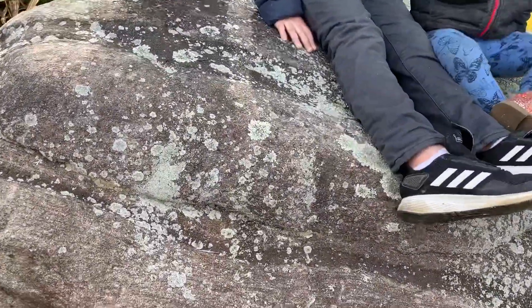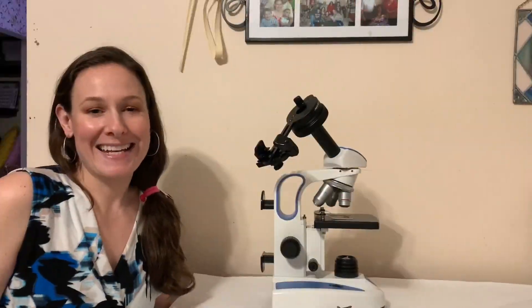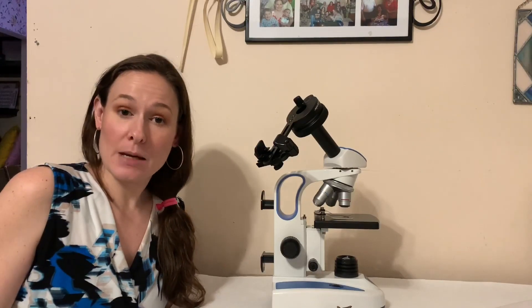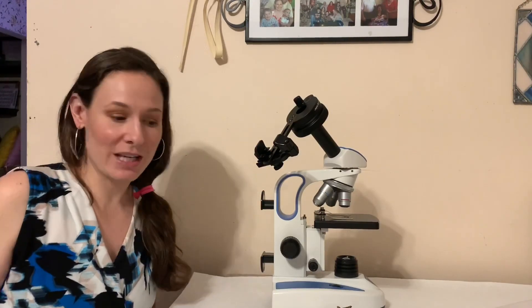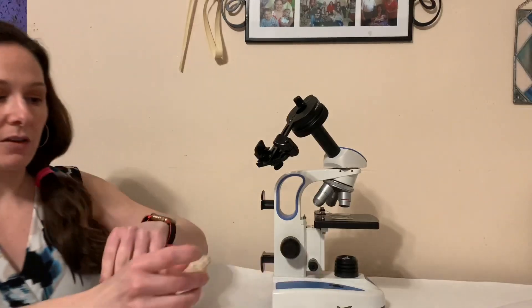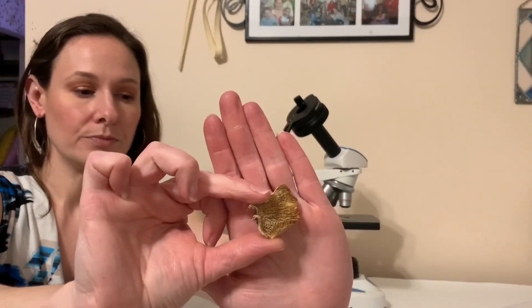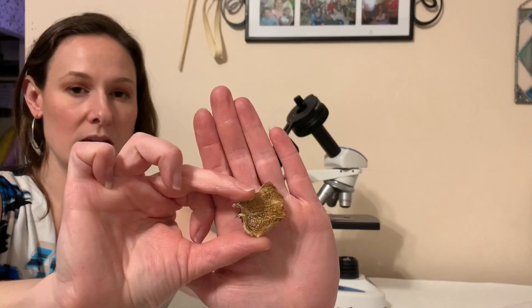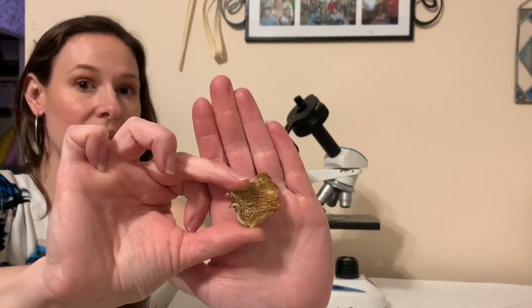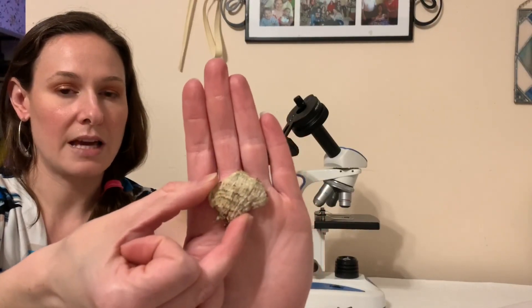Well, wasn't that an exciting adventure! So let me show you some of the samples we collected along our journey. First we have our shelf mushroom, and if you look closely, what do you see? Gills — very good. This is the top of the cap.